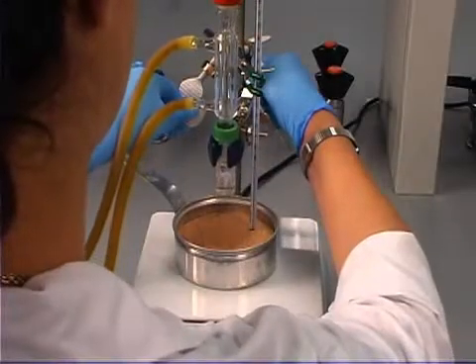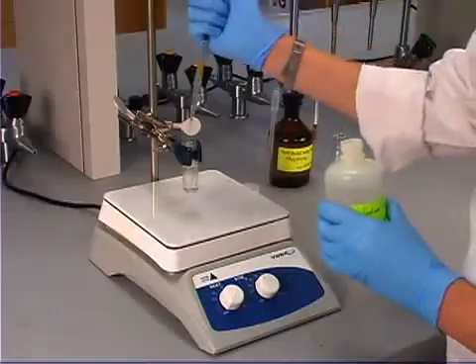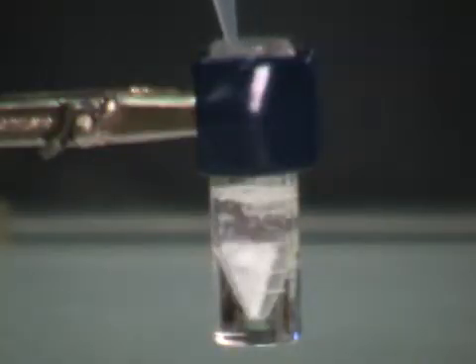To stop your reaction, remove the vial from the heat, and once it's cooled to room temperature, you're ready to quench the reaction with base.